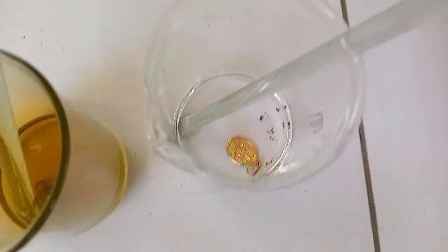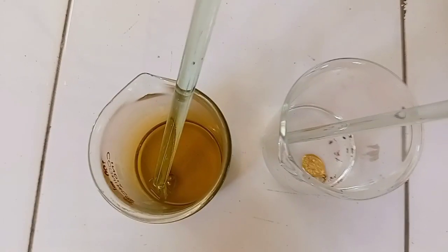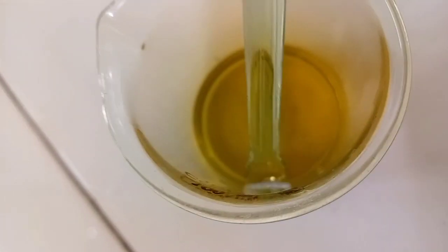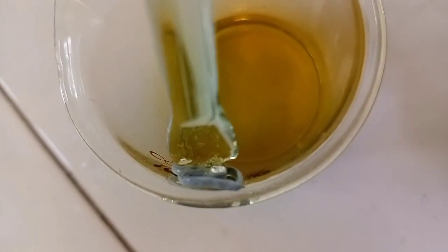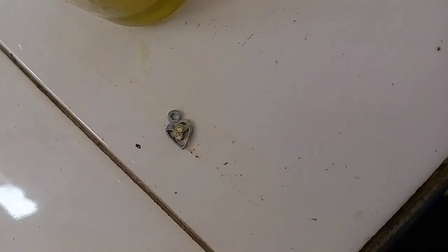There are several noble metals like silver, palladium, platinum, iridium, and so on. The gold sample is unreacted. Now let me show you the non-gold, the fake one — what happened to it. It became black. It was goldish-yellow before, and it is black now.